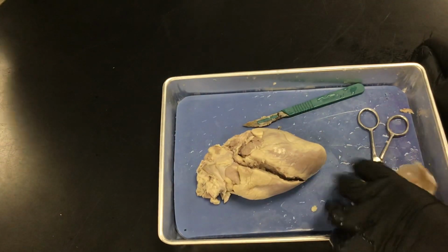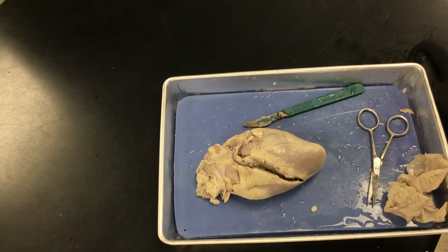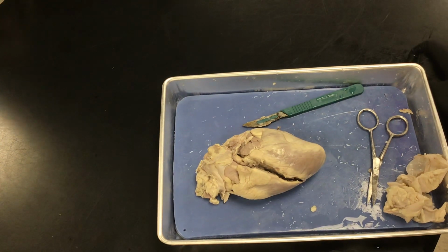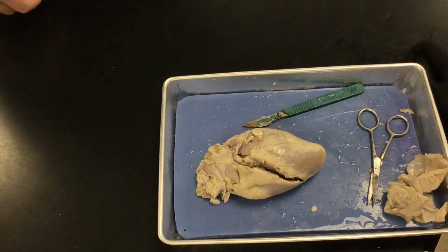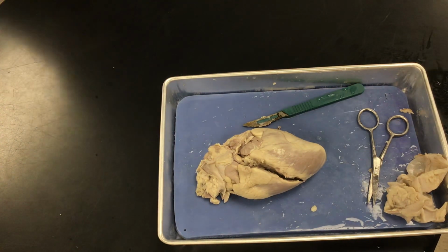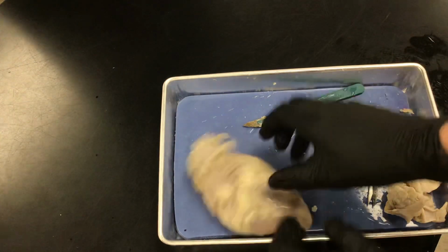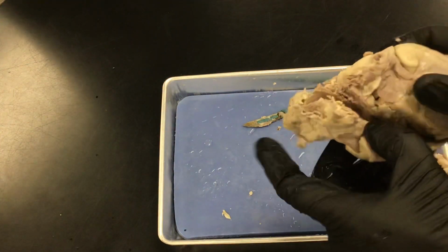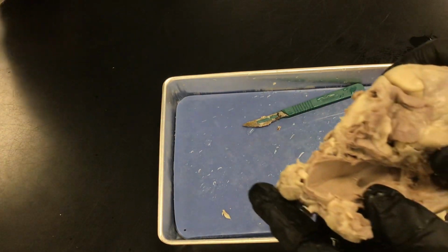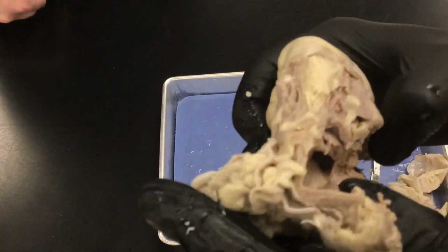Open the chamber, locate the tricuspid valve, and examine its cusps. Run some water through the tricuspid valve to fill the chamber of the right ventricle. I don't know if we need to do that. So open the right ventricle as follows. So now you can see what's inside one of the tubes of the vena cava. And then we need to find the right ventricle now.